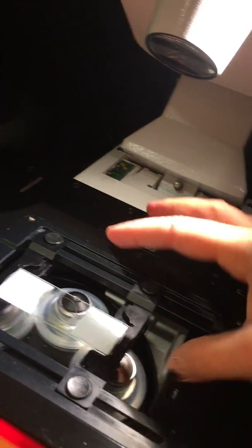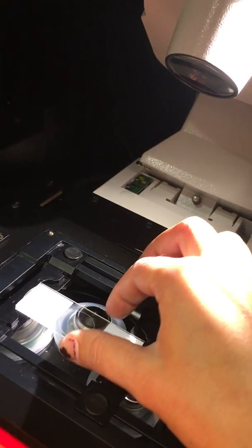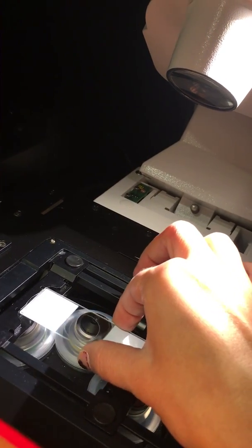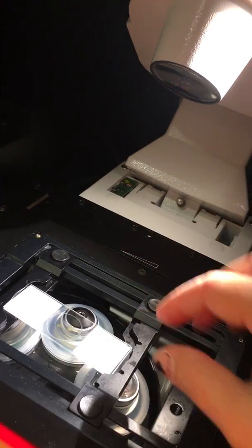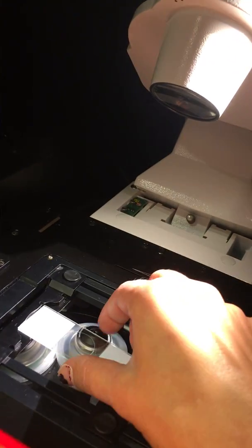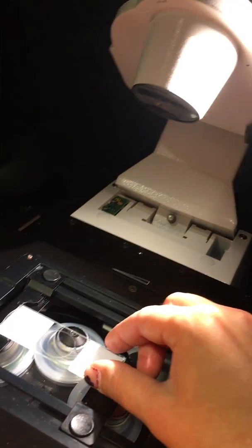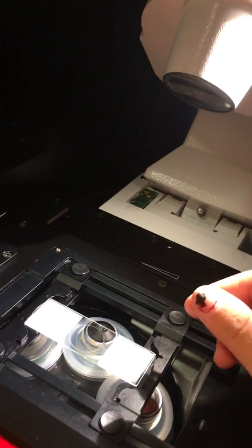I would advise you not to press these holders too tight, for the sample to be able to be lifted up. In case you use a high magnification lens and accidentally run it way too high, it will just lift your sample instead of cracking it. And we don't want to crack your sample, in order not to scratch the glass of the lens.